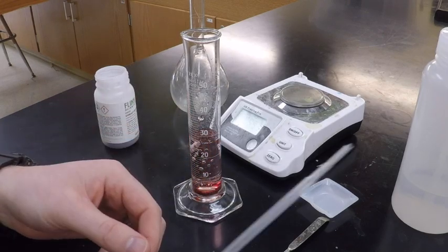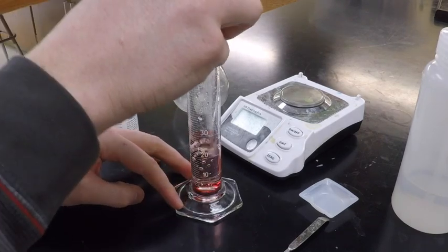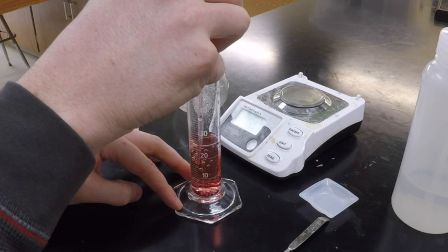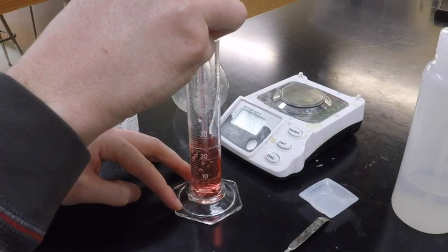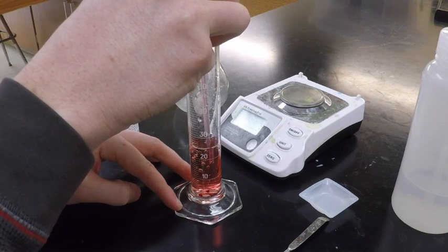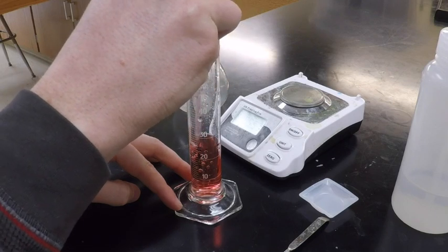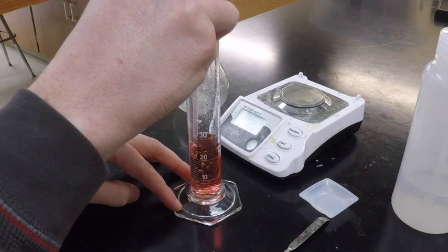So what I will do is I'll give you a pipette. That serves two purposes. The first purpose is I need to make sure all this dissolves. And remember, we talked about this in one of our earlier lessons, a factor that affects how quickly something dissolves is agitation or stirring. So what I'm going to do is I'm just going to suck up some liquid and push it right back out. That will help my solid dissolve.